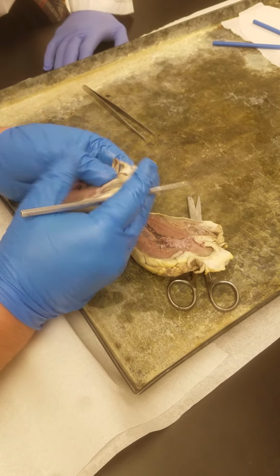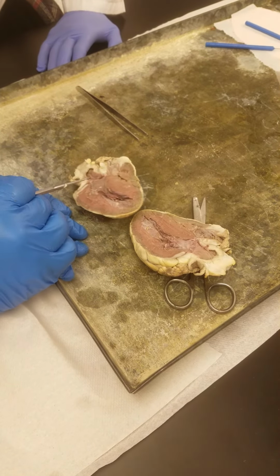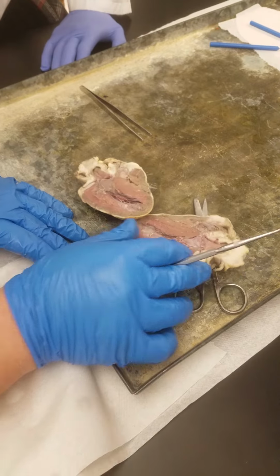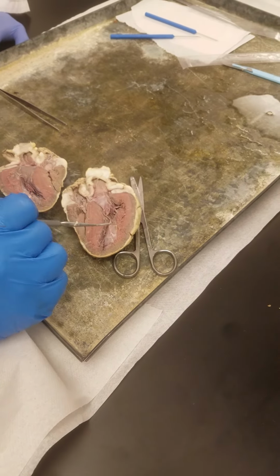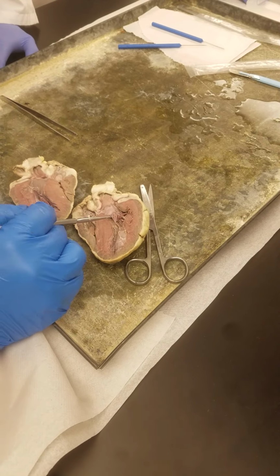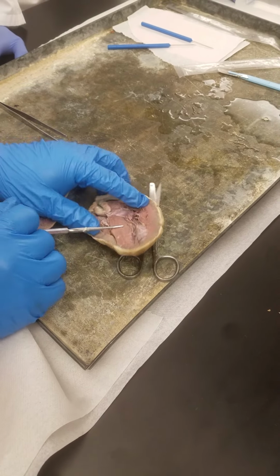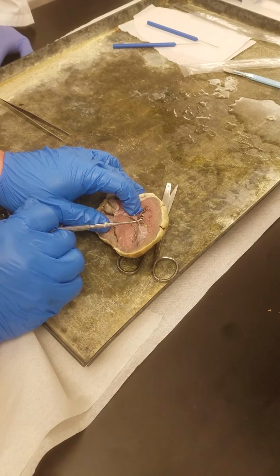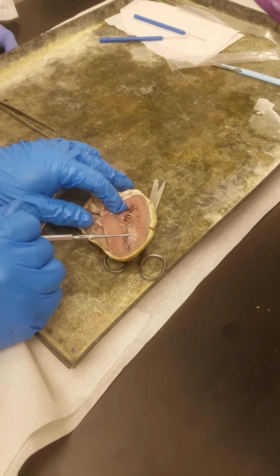Okay. Left ventricle side. So you've got a bit of left atrium over here. Looks like left atrium up here, left ventricle down here. So this flap right here is the left AV valve or the bicuspid valve or the mitral valve. It also has chordae tendineae attached to it, also attached to a papillary muscle. But look at how much bigger this one is.